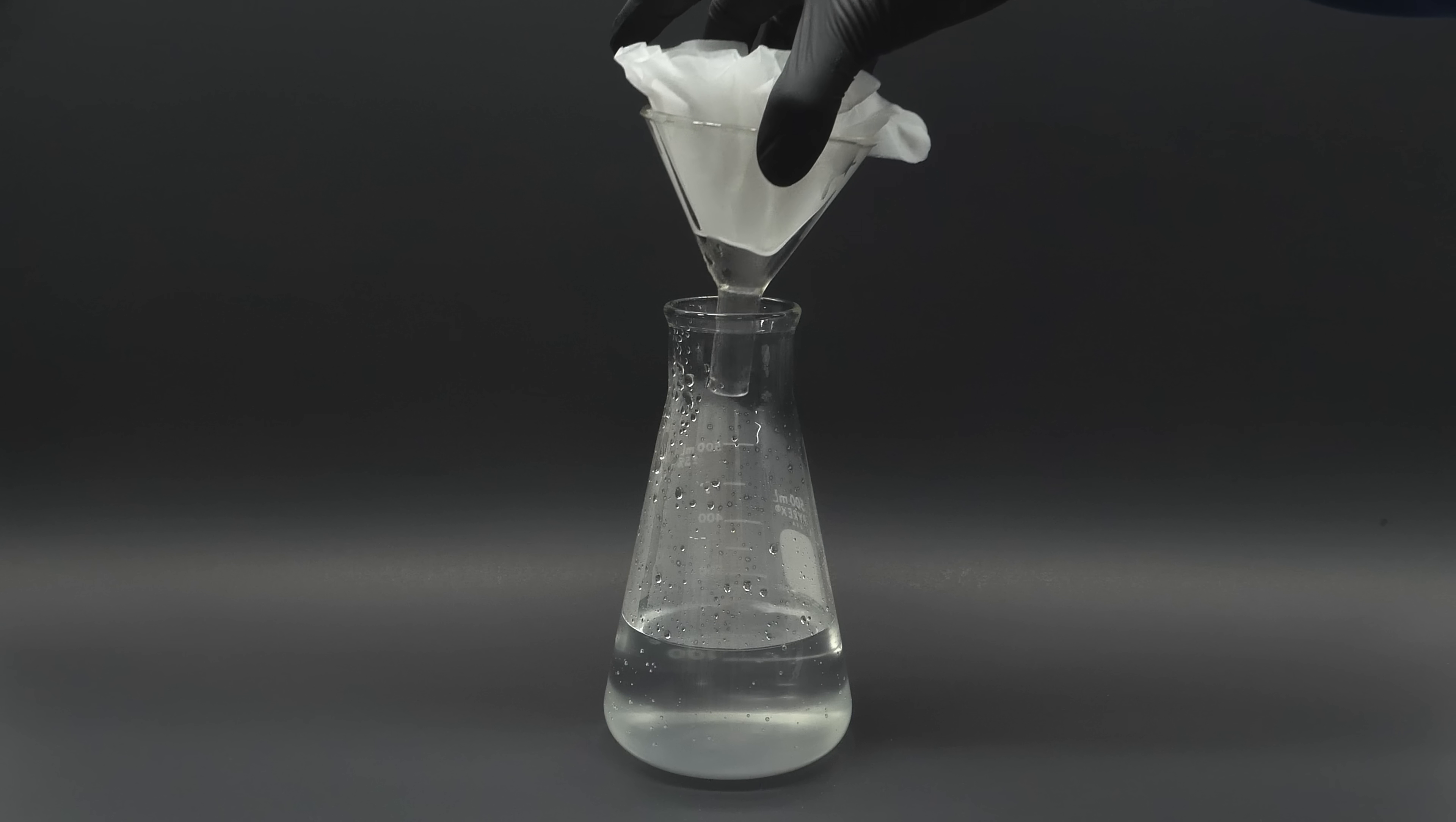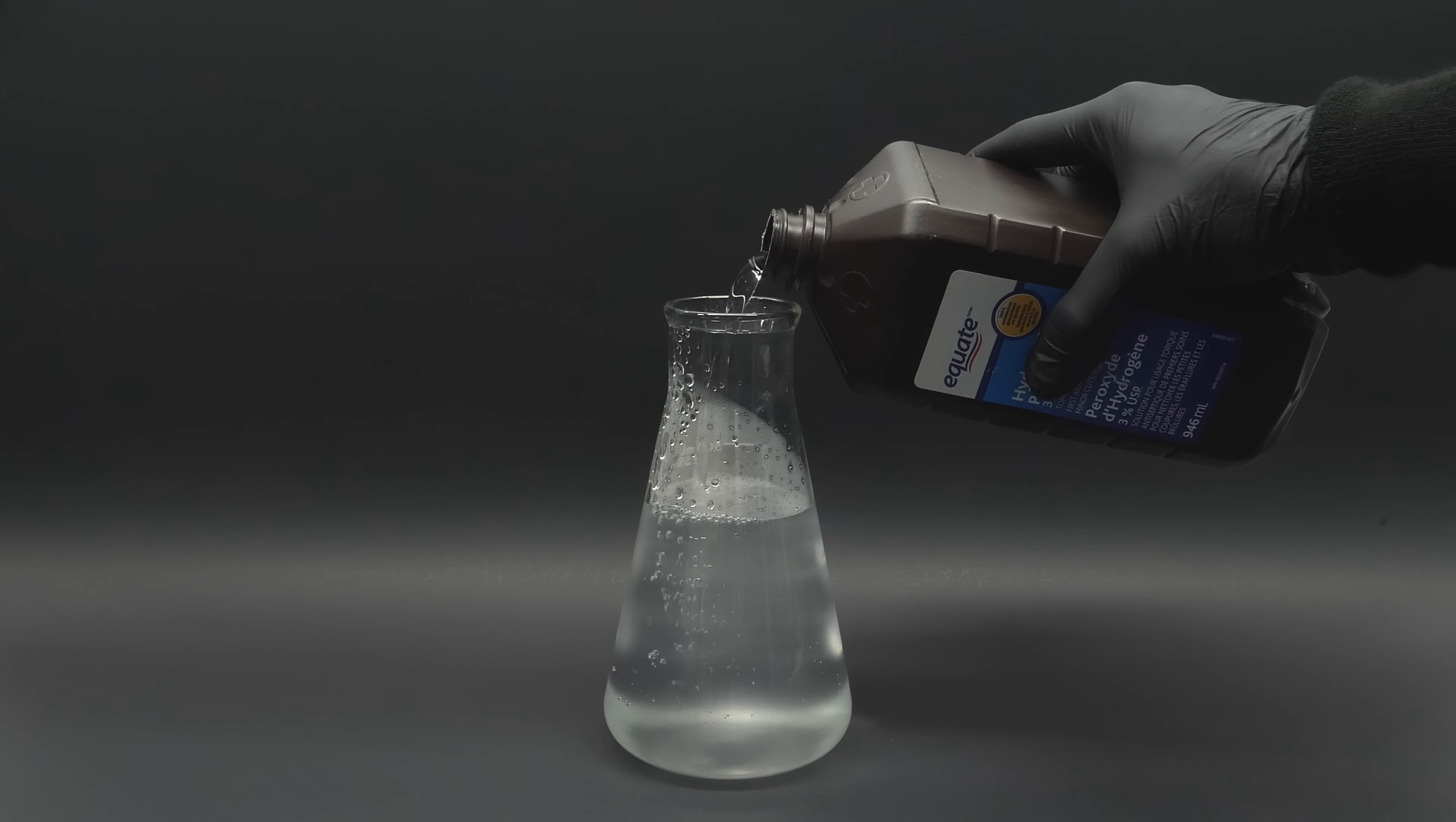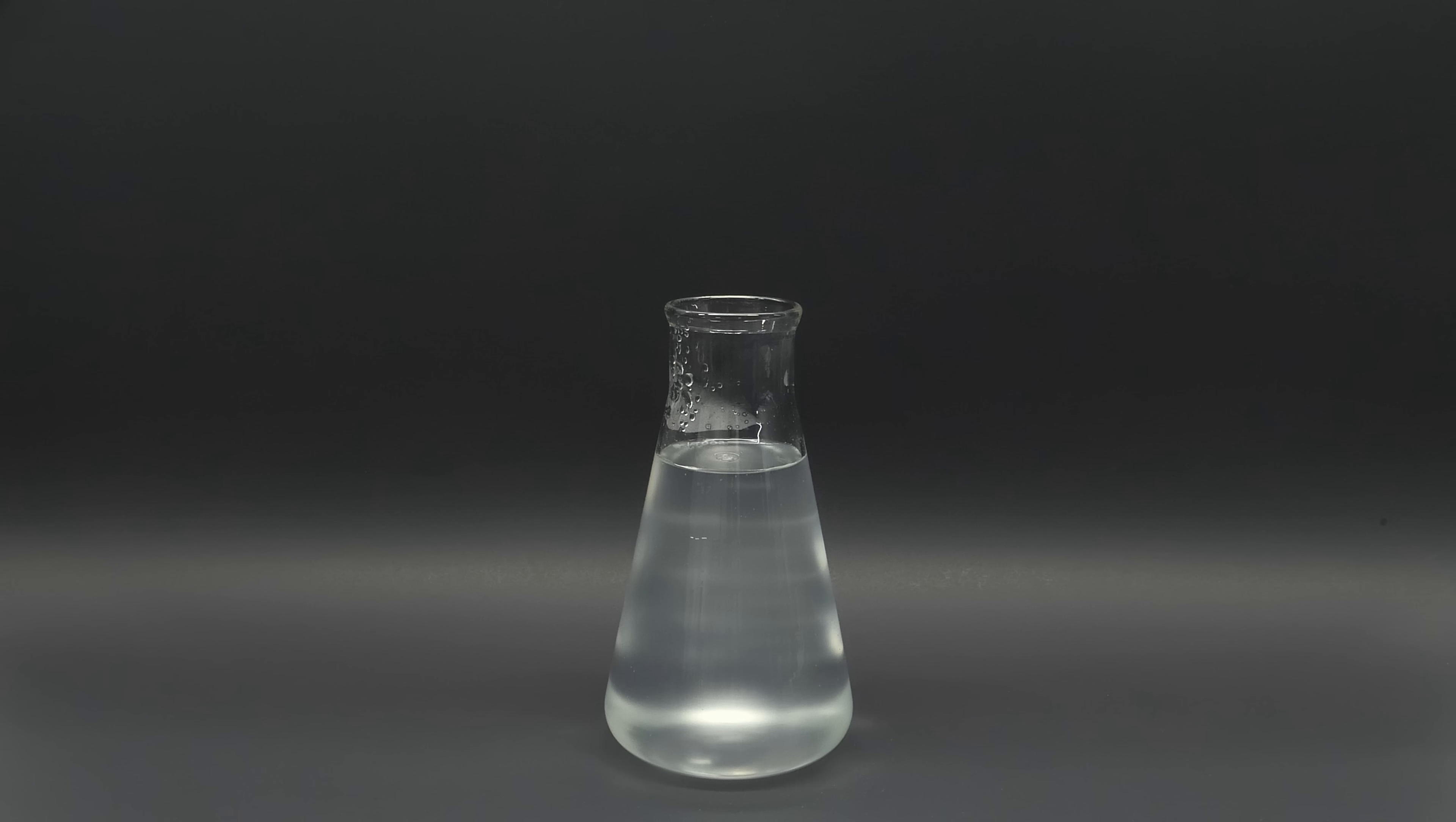It took a while to finish, but when it was done, I added some hydrogen peroxide. I'll mark this as part B, and the next thing I have to do is make part A.